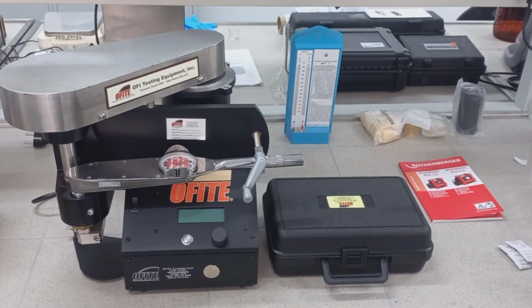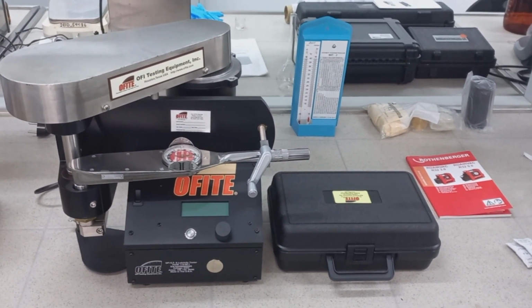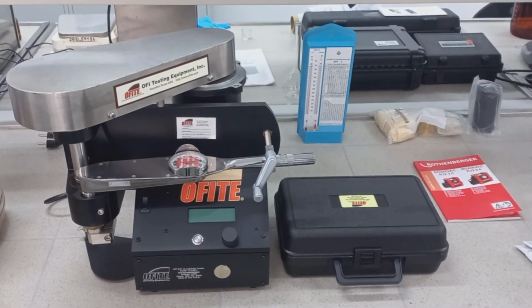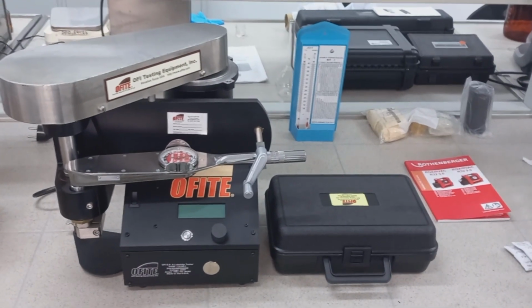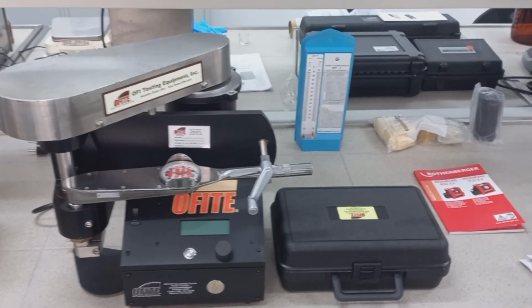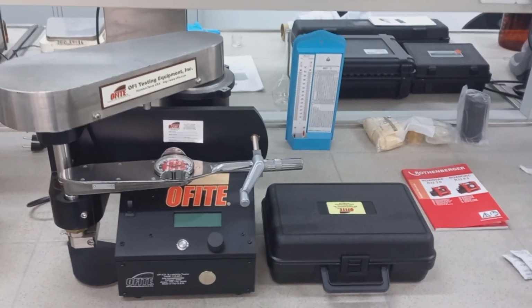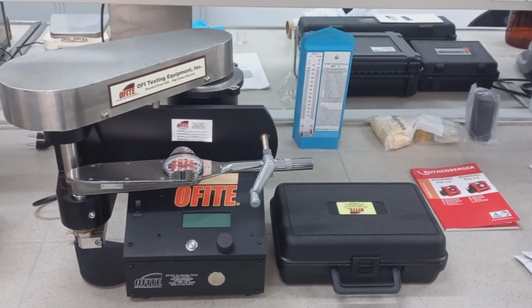The EP and lubricity tester is a high-quality instrument which is used to measure the lubricating quality of a drilling fluid. Also, this instrument provides data to evaluate the type and quantity of lubricating additives that may be required. Besides that, it may be used to predict wear rates of mechanical parts in known fluid systems.